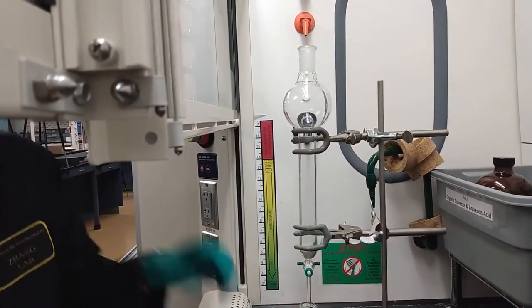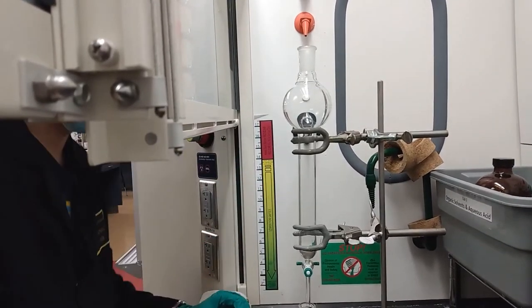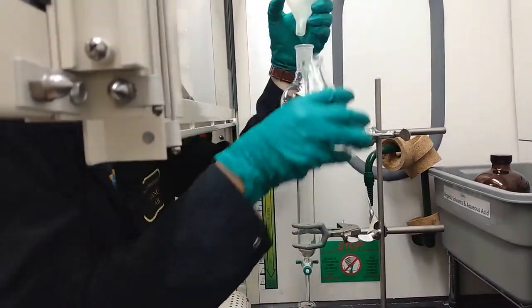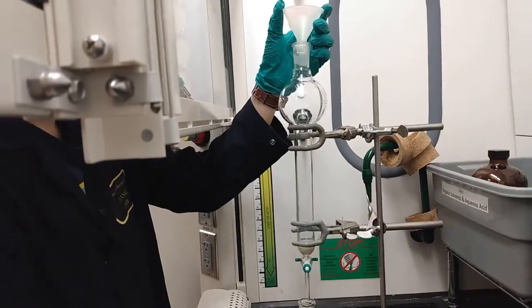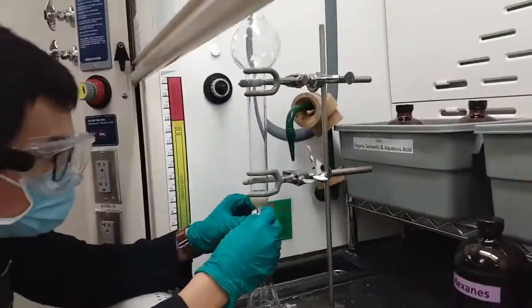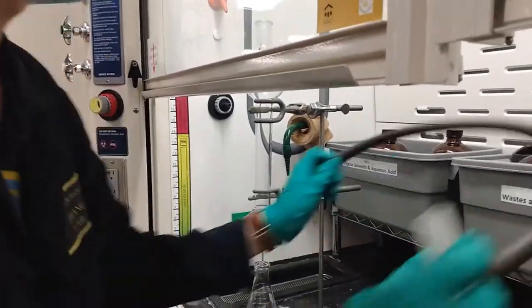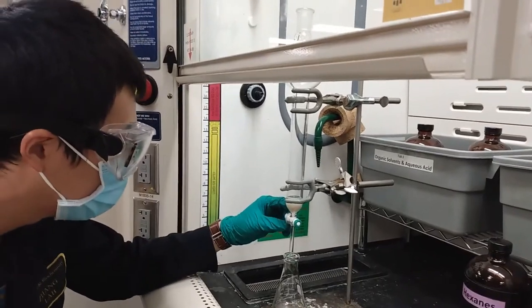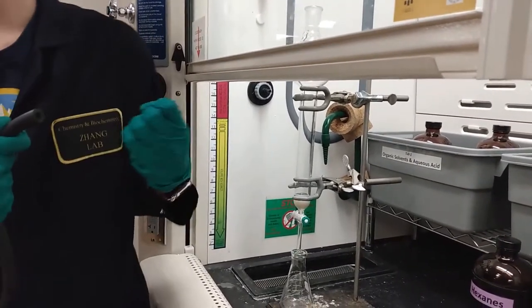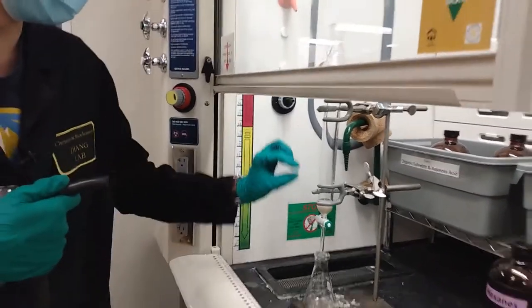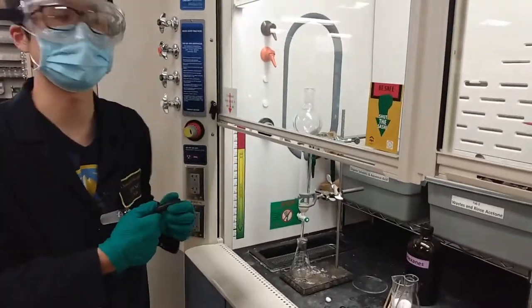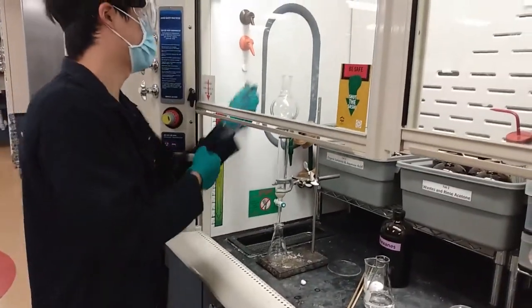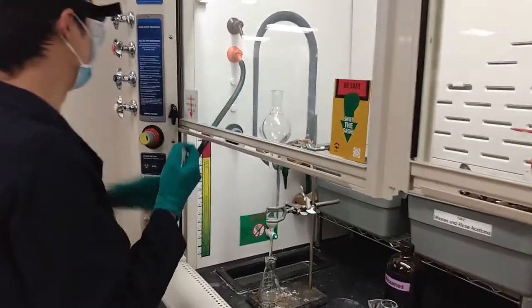Next we need to use a little bit of hexane to rinse it off. If gravity is not sufficient to elute down all the hexane, we can use air to press it down.